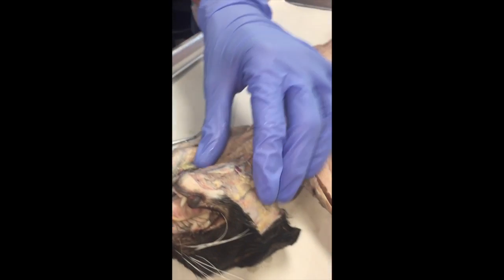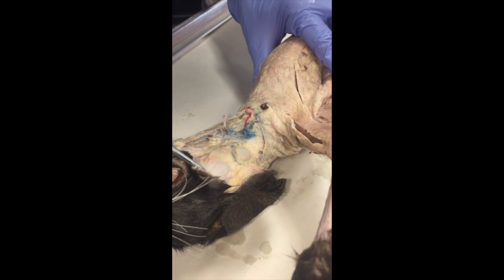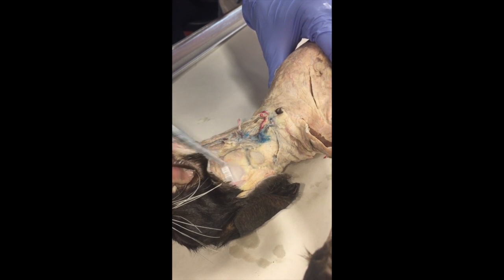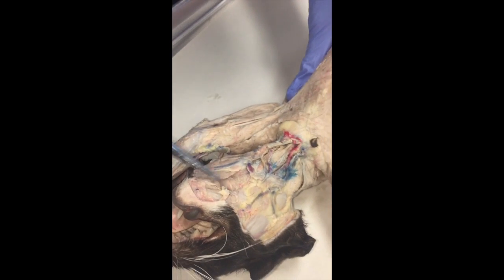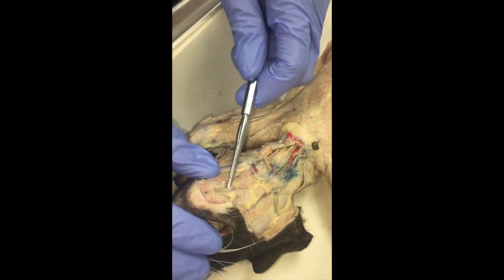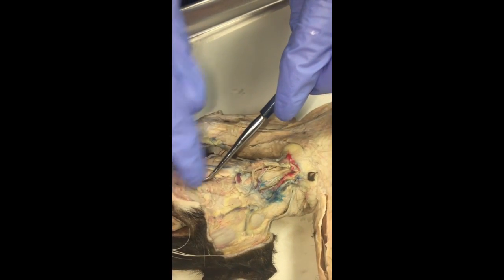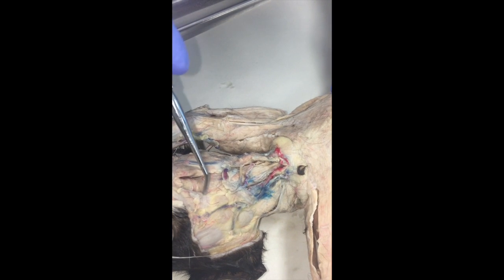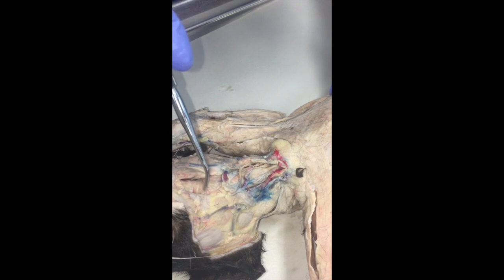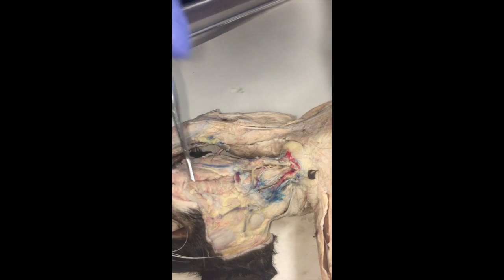We'll start with the head and neck region. First, masseter is the cheek muscle right there. Then we have, along the mandible, the digastric muscles. Here's one, here's the other. They make this kind of V-shape going this way. Between the digastric — digastric means two bellies because it's a muscle with two bellies. And then we have the mylohyoid, which has these transverse striations that go across horizontally.